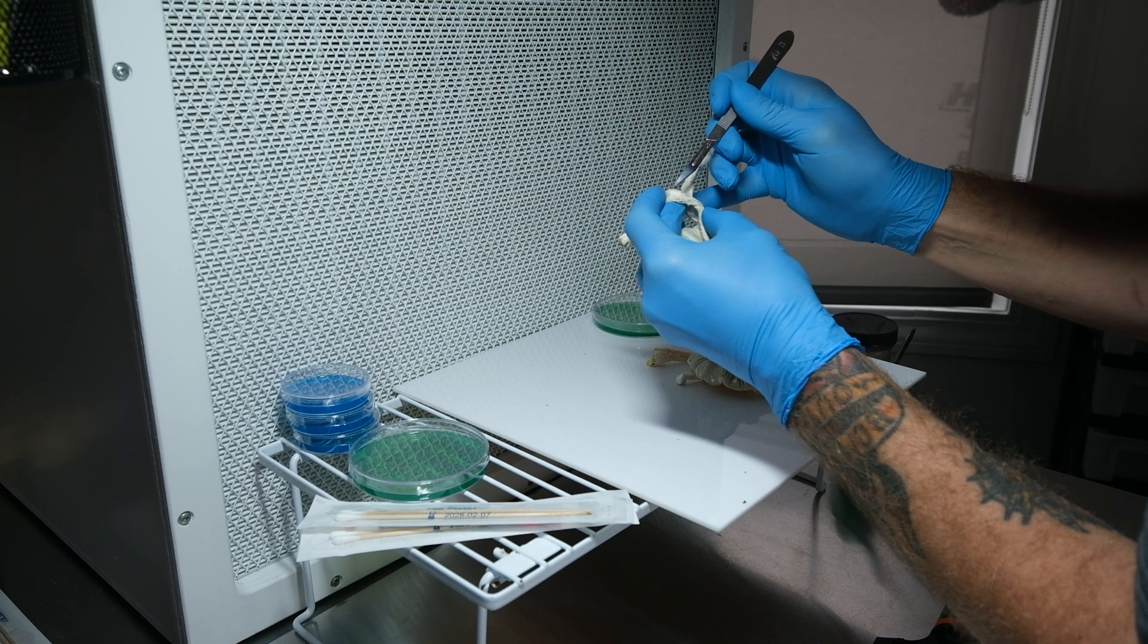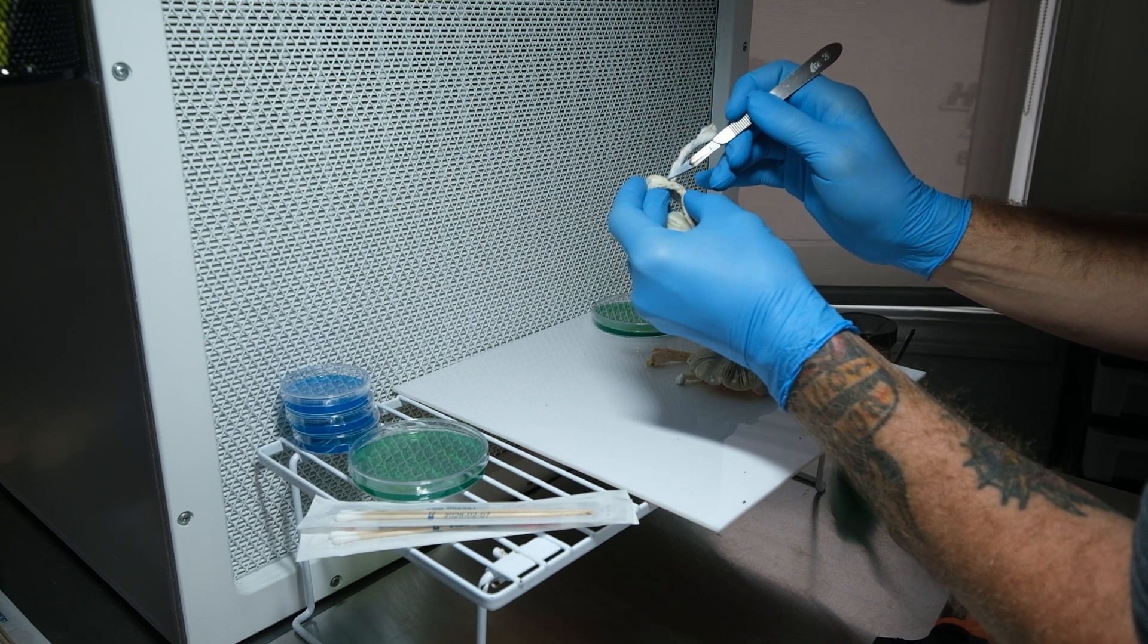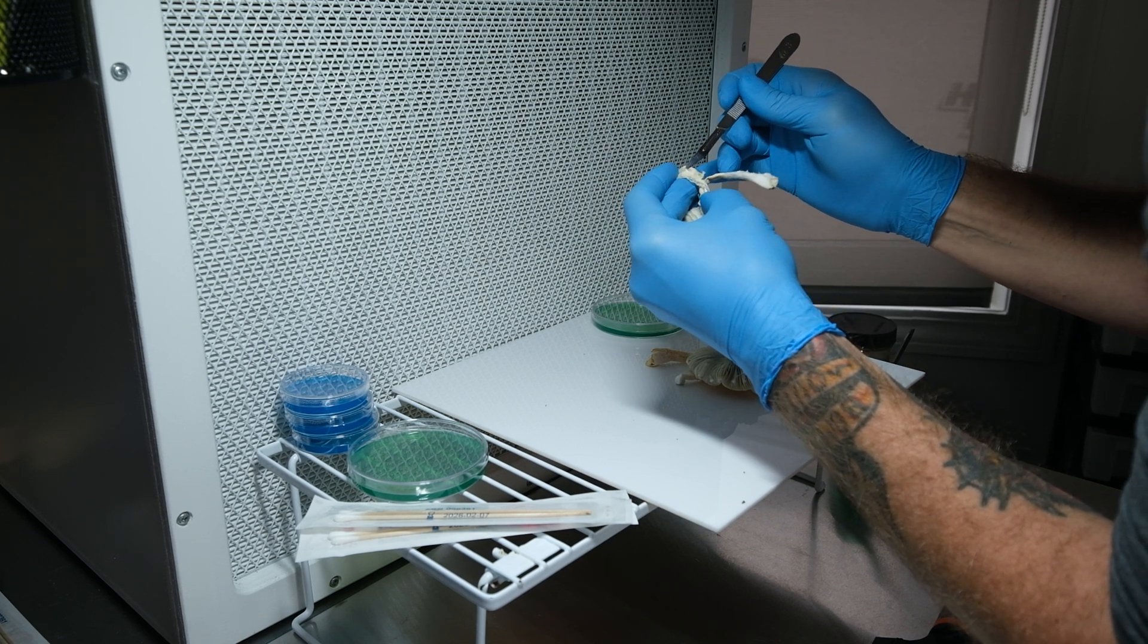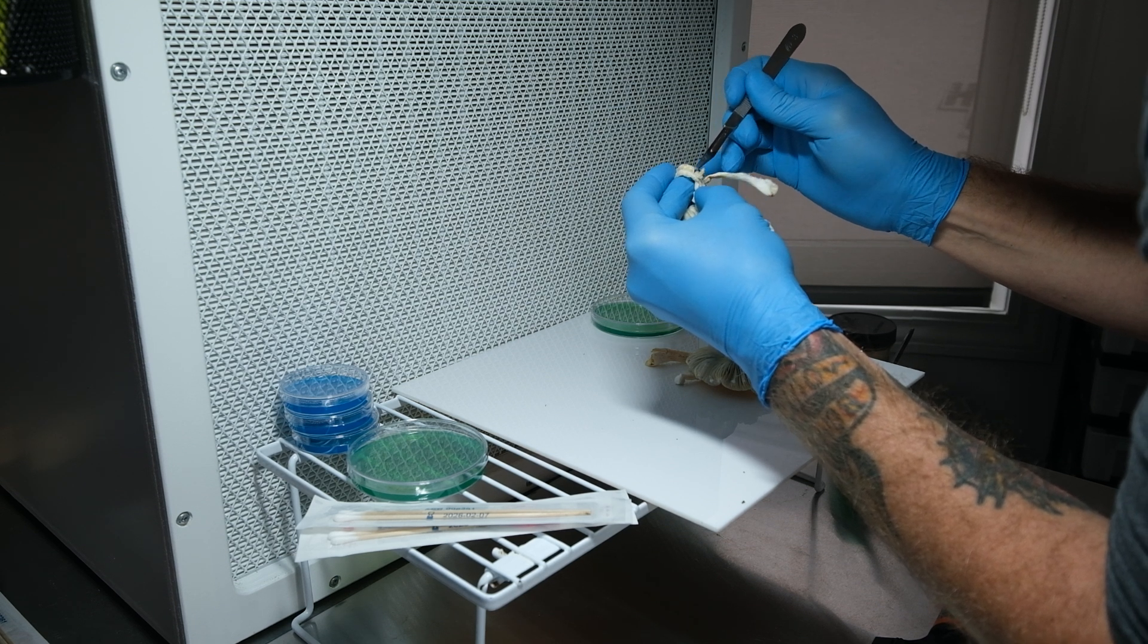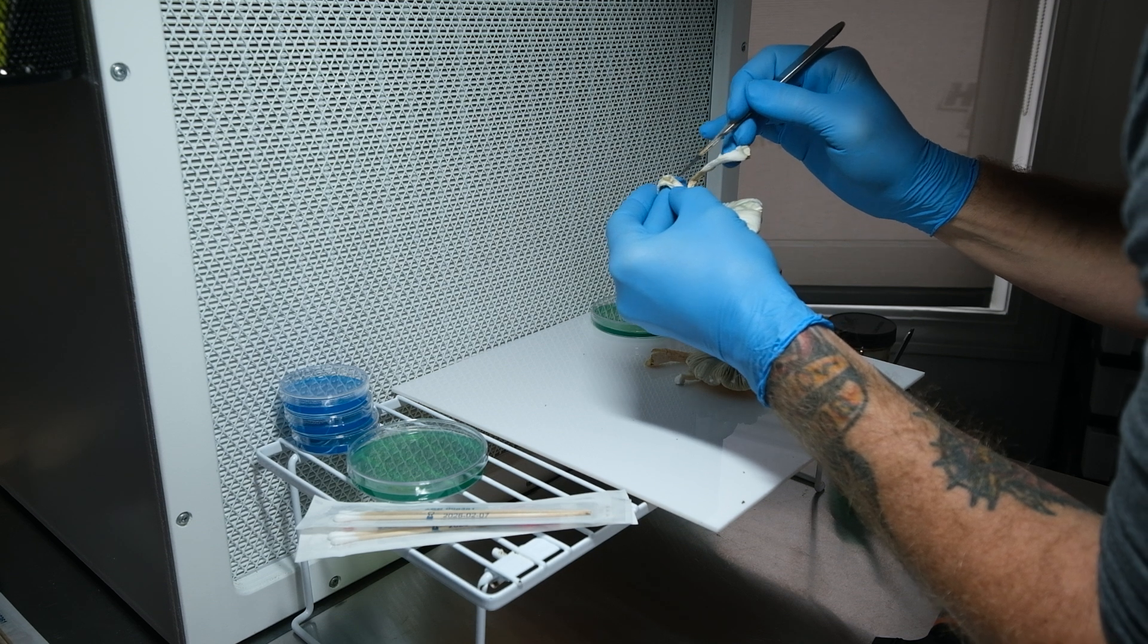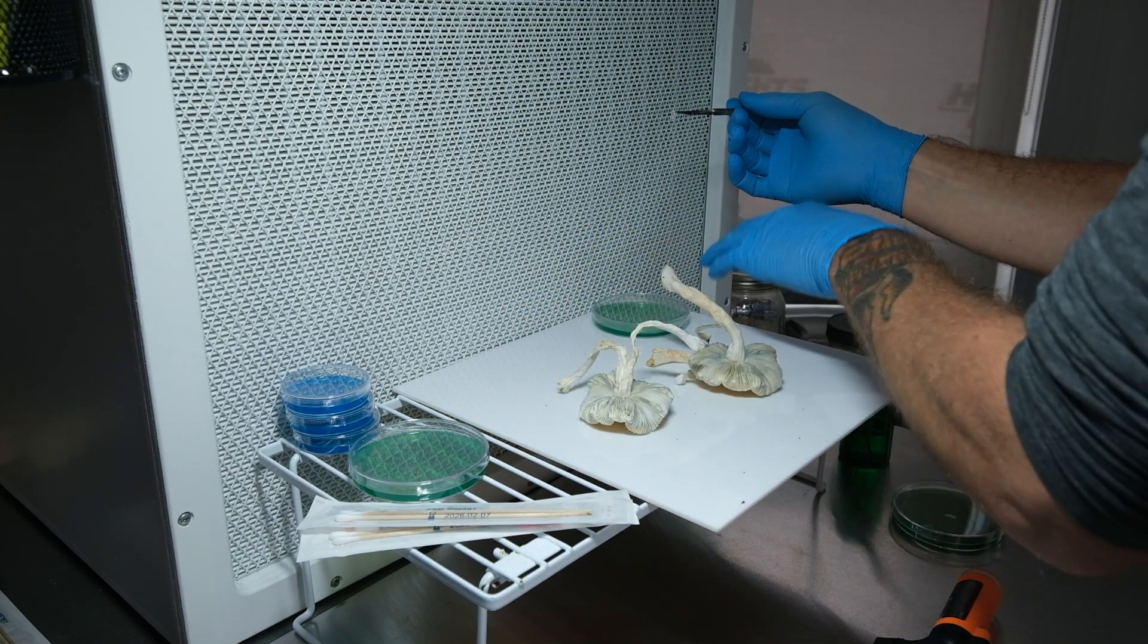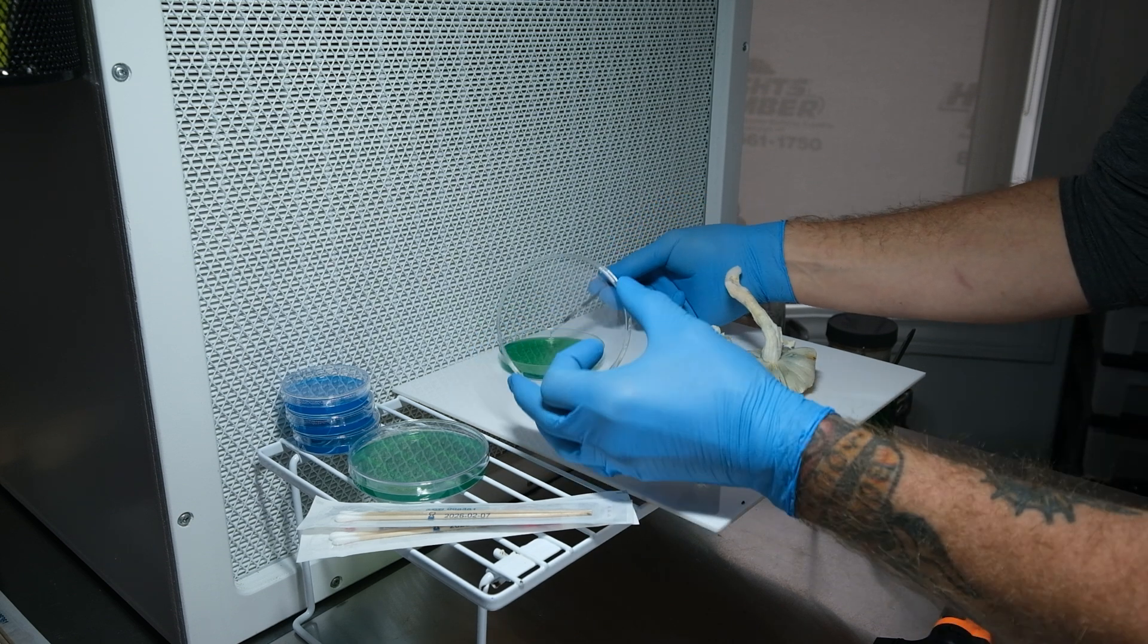I'm going to take a small tissue sample, actually a rather large tissue sample. I've found the small samples don't really do much so I've started taking a little bit bigger ones. Sometimes you don't need much but like to get a little bit here. Yeah, definitely use a sharper blade for this.